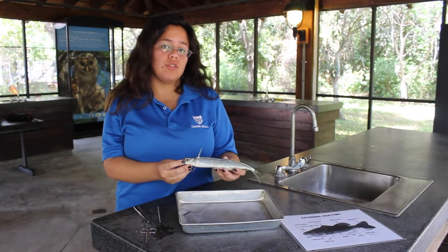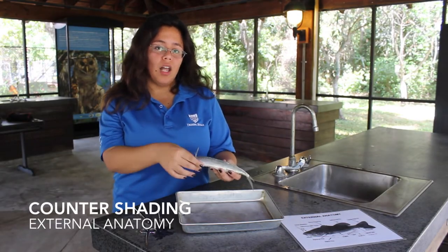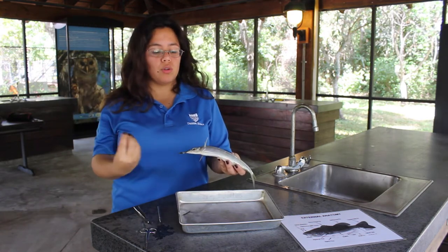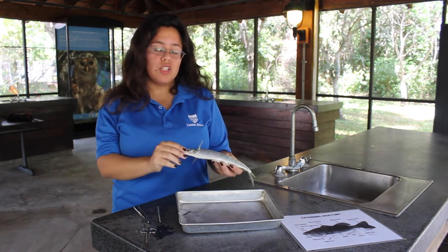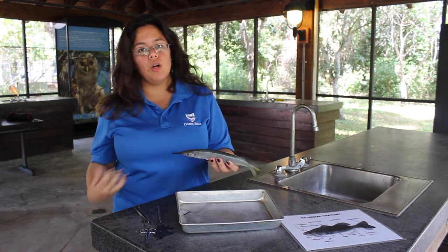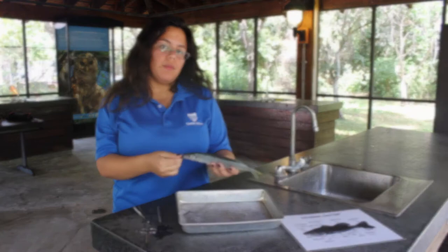Animals exhibit counter shading just like this ballyhoo. The bottom is a light color so that when it is swimming towards the top, the sun shining through creates a camouflage for this fish. And then the top is dark so that when it's down below, the dark blue water hides it from predators above.